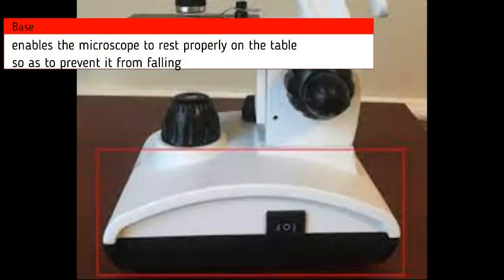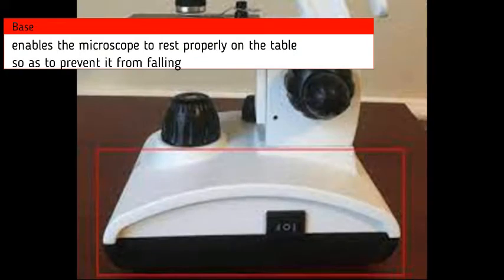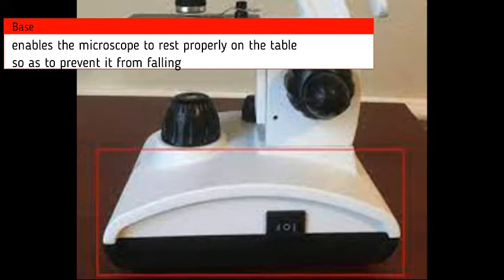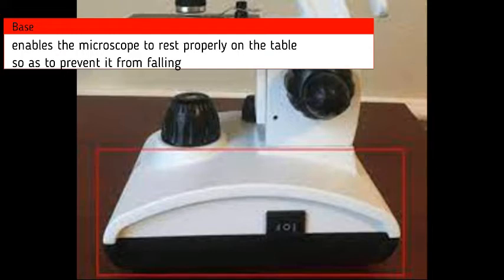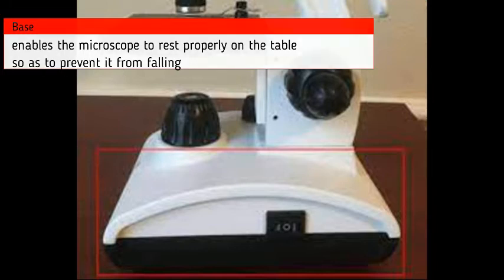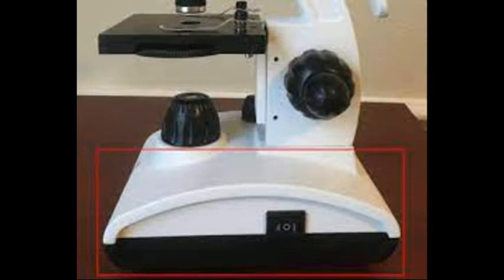The base is the metallic part which enables the microscope to rest properly on the table and prevents it from falling. Basically, the base acts as the stand of the microscope, keeping it stable and in place.